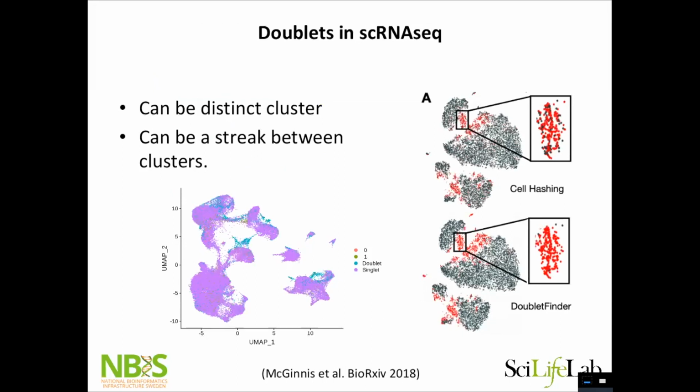And when you look at clustering and so on, this is from the cell hashing experiment that Jules talked about, where you have antibody barcodes on your samples and you do it together. And this is predicted doublets with one of these tools to predict doublets. But quite often, you might get a distinct cluster of doublets, and then it's really easy to find them. But quite often you get these streaks in between 2 clusters with cells that have the signature of both clusters. And now you're in a problem. In this case, this group believes that there's differentiation of this cell type to this cell type. And I think that most of the stuff in the middle is doublets.